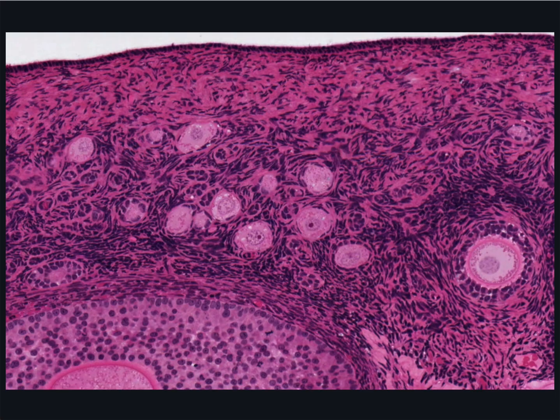Microscopically, a mesothelial layer of columnar or cuboidal cells covers the surface of the ovary. This is incorrectly termed a germinal epithelium. A dense connective tissue capsule, the Tunica Albuginea, is just under this germinal epithelium.